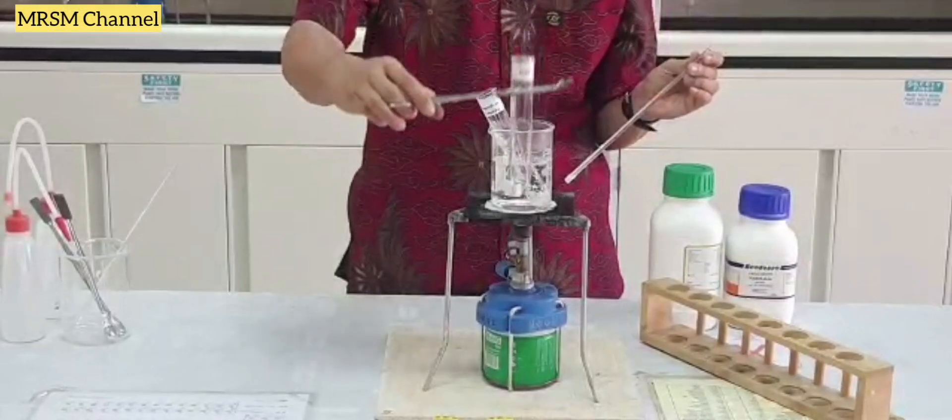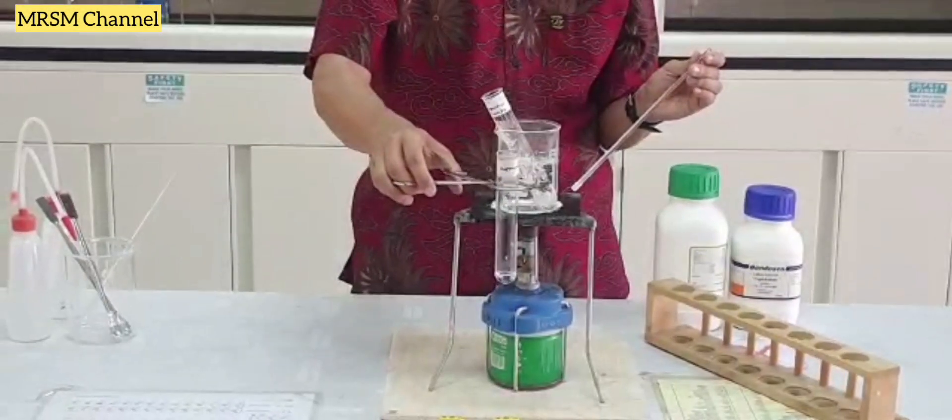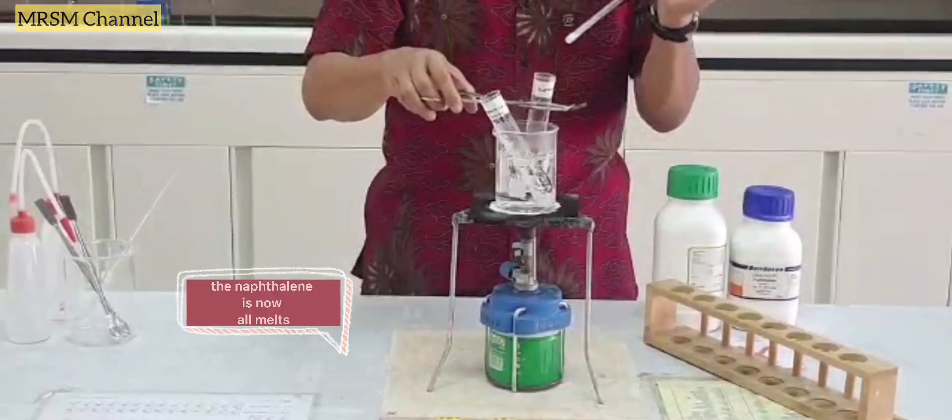Especially the naphthalene. Look at the naphthalene now, it all melt in the water bath.